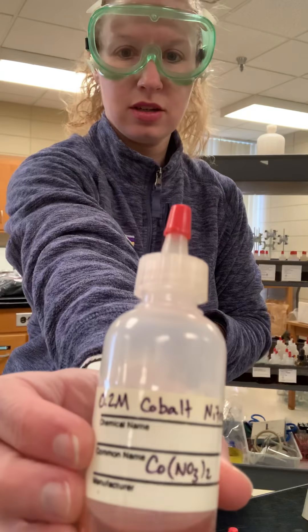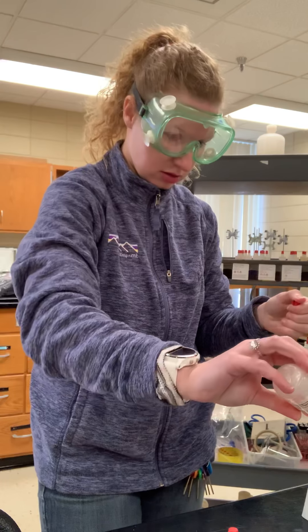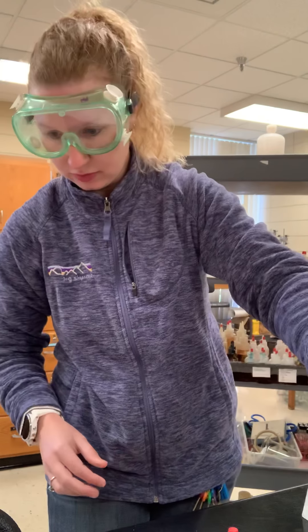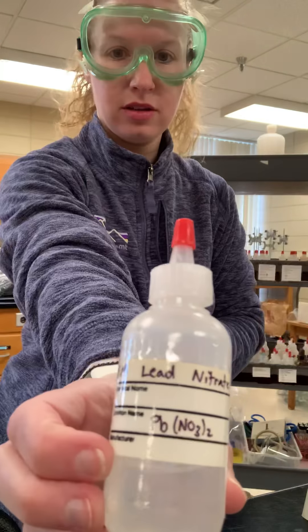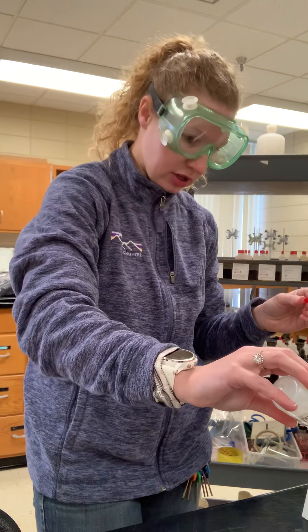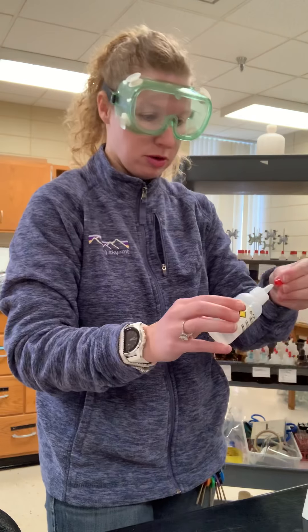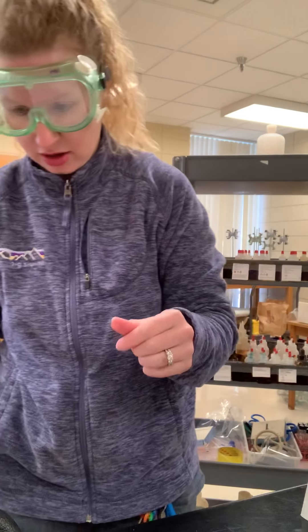Cobalt nitrate. Now I bet there's something you notice in common with all of these — what's the anion in all of them? And who remembers from solubility rules what we know about this anion?